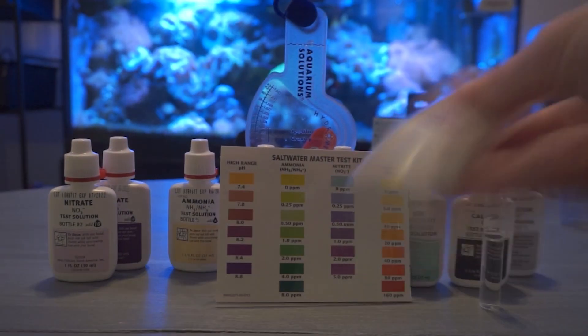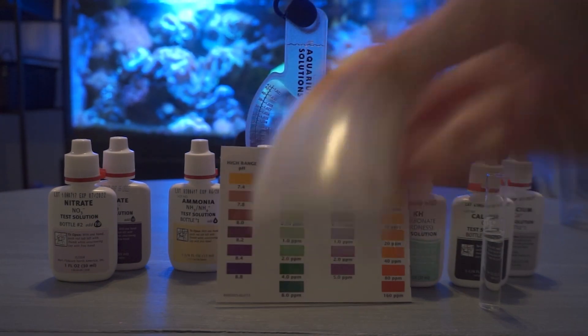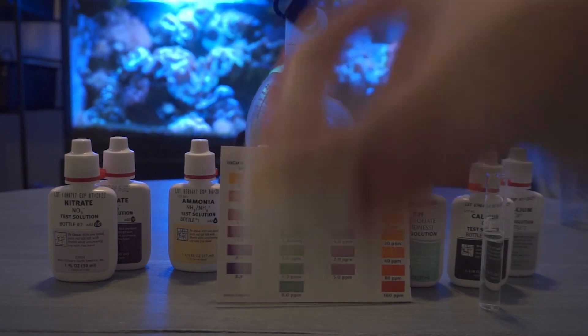Now one thing to always be doing before you actually put this into the test sample is shake it up. Shake it up for about 15 seconds on each bottle that way it mixes up that solution really well to give you the best accurate test.